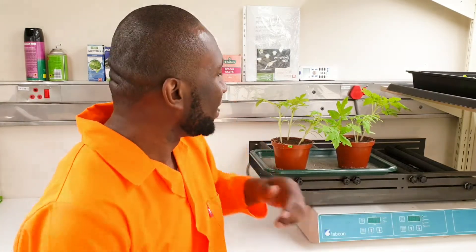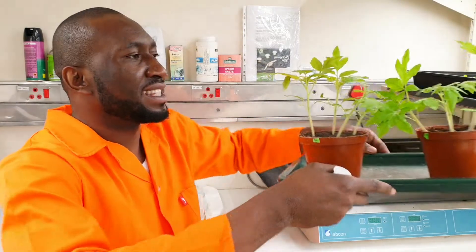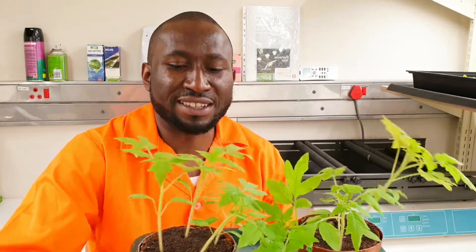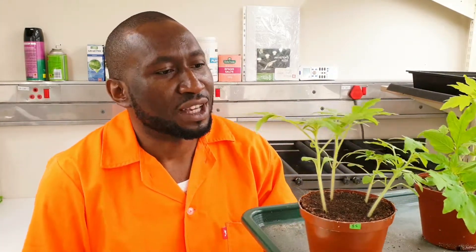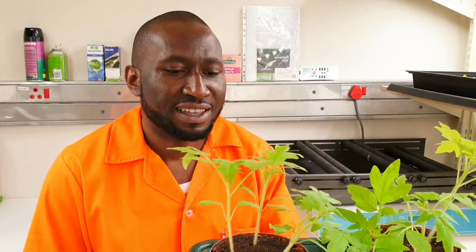So you can see these tomato seedlings. It smells so nice and cool. This tomato seedling is about 4 weeks old. You can see they are doing very well. I will take you step by step on how you can plant it and have it grow to this level.